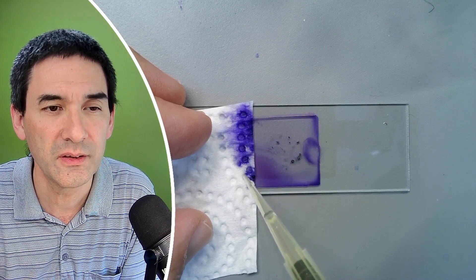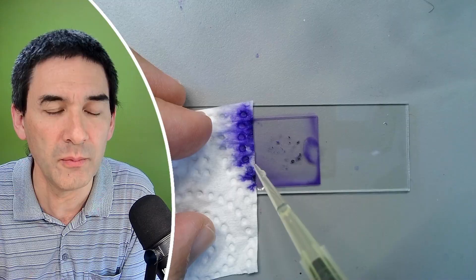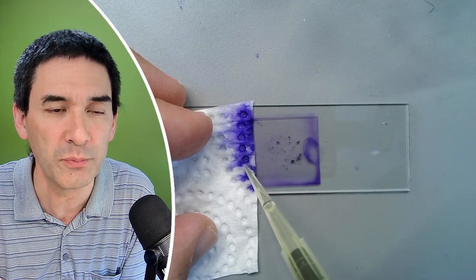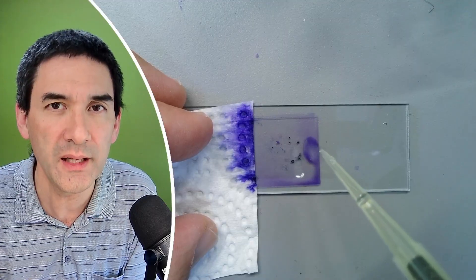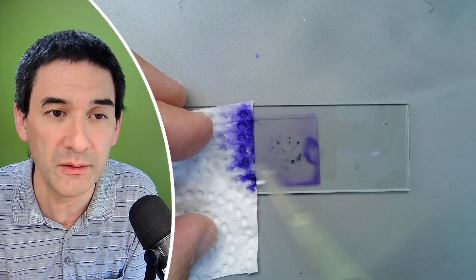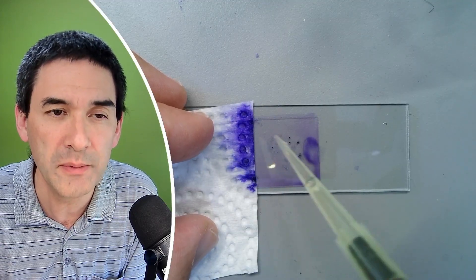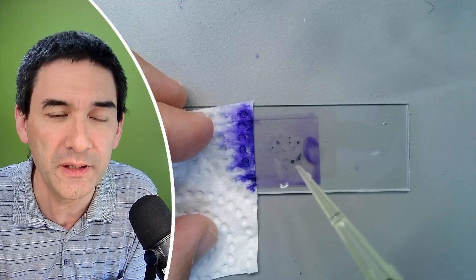I'm just using the tip of the pipette simply to hold the filter paper. But I think you get the idea. I added water on one side and I removed the stain, the medium on the other side and then there will be many spores will still be left in here.